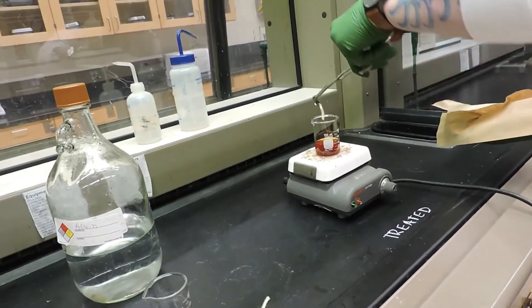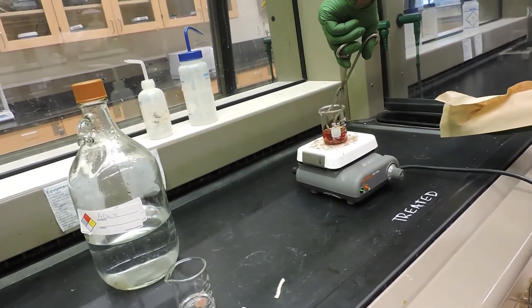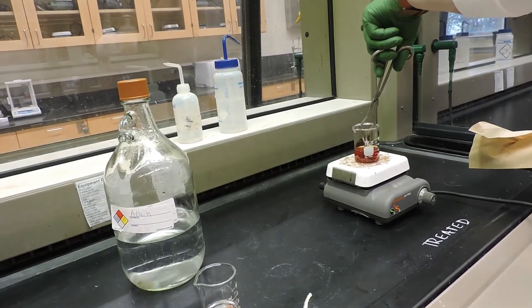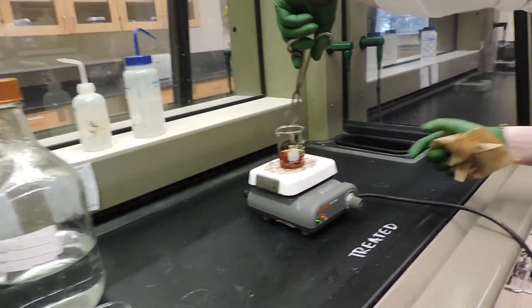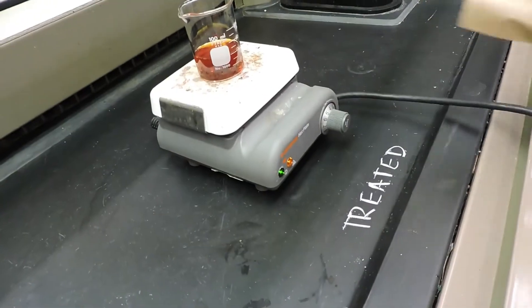So now we will immerse it in a hot alizarin dye bath for two minutes. So this is our treated bath.